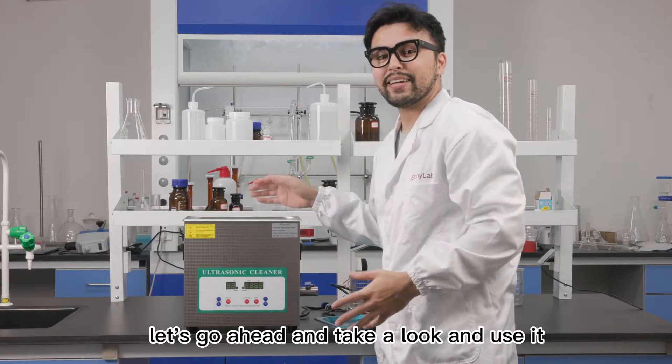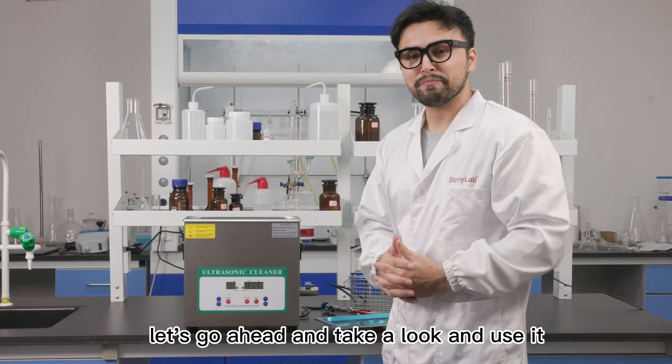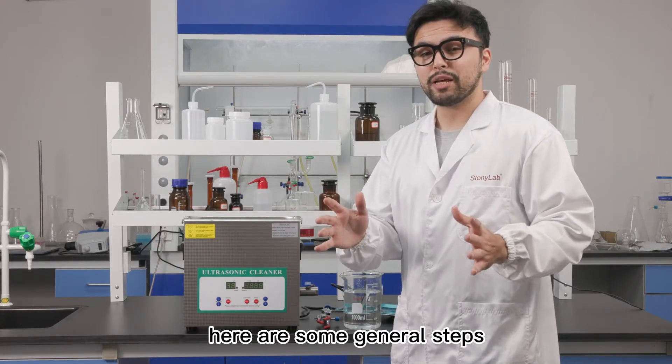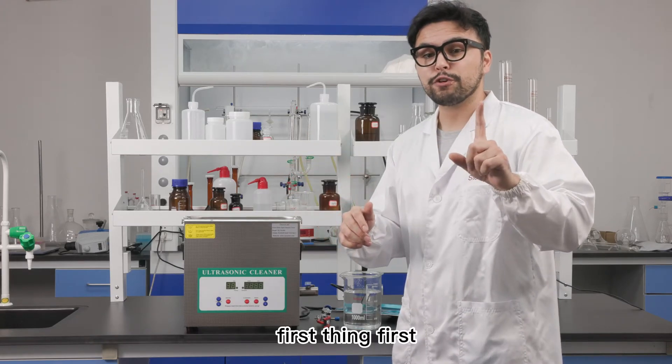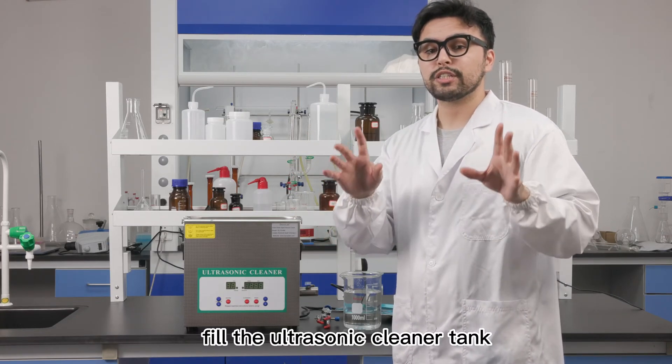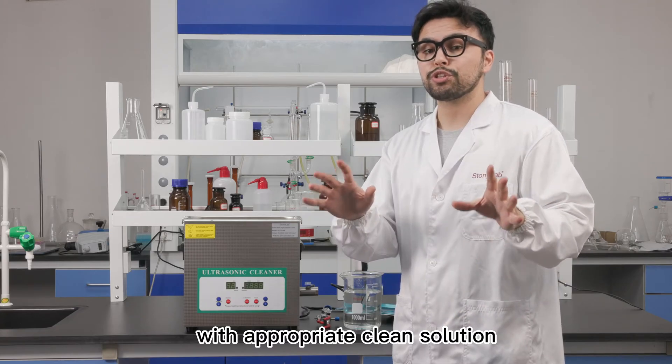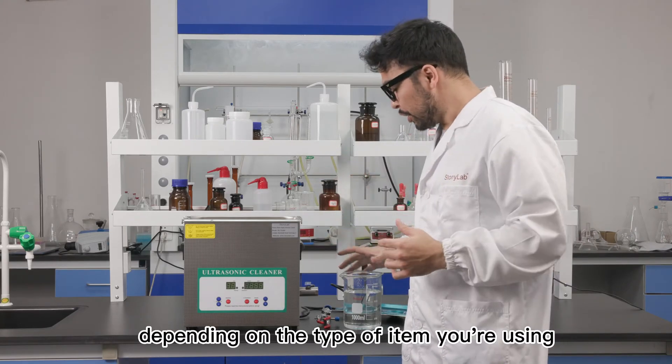Let's go ahead and take a look and use it. Here are some general steps how to use the ultrasonic cleaner. First thing first, fill the ultrasonic cleaner tank with appropriate cleaning solution depending on the type of item you're using.